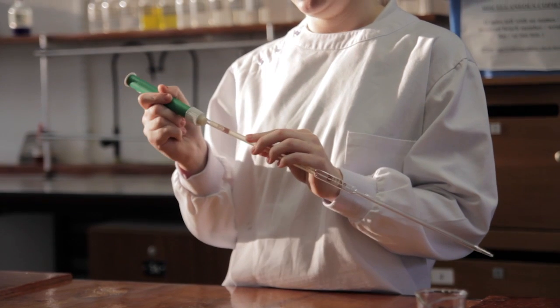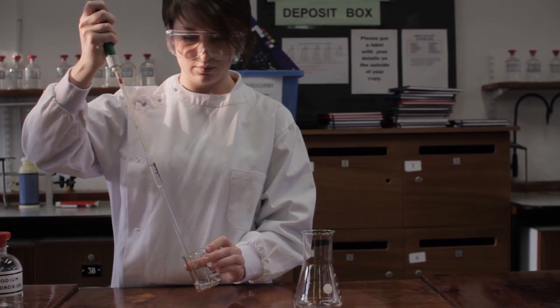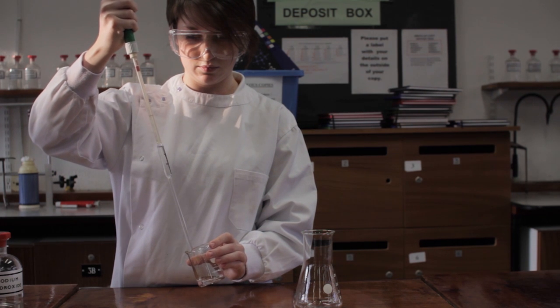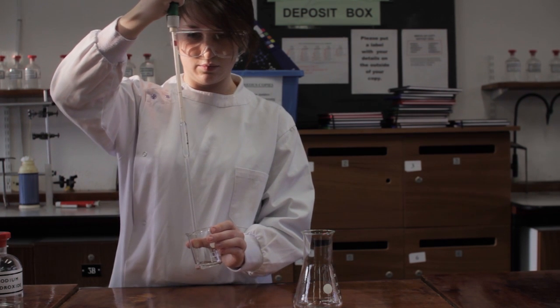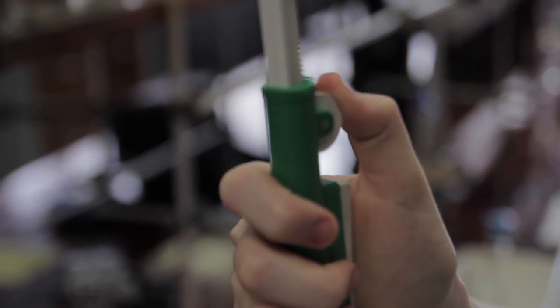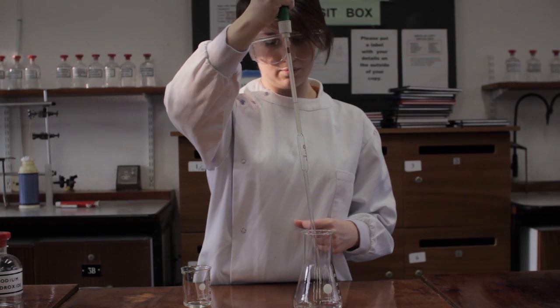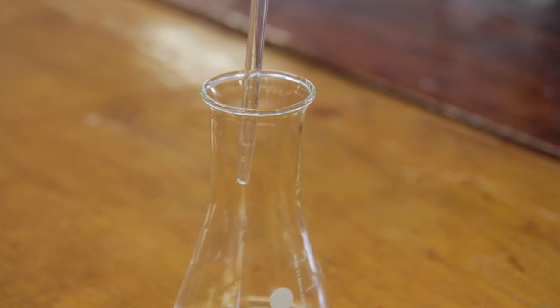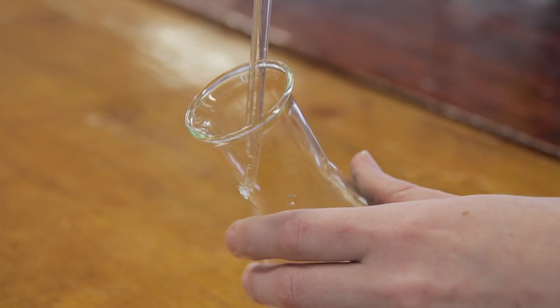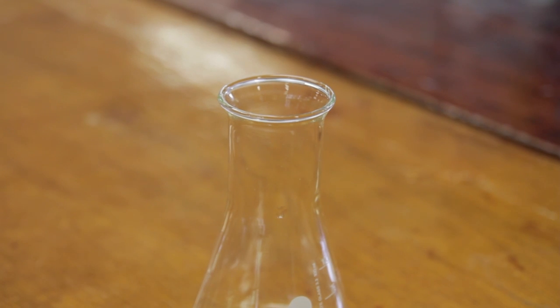As you've seen already, the pipette is used for aliquoting small accurate amounts. Before using the pipette, you must rinse it with distilled water and again with a sample of the chemical you are using. Use a pipette filler to draw the chemical into the pipette and do not exceed the calibration mark. Empty the pipette via gravity. Note: touch the tip of the pipette off the side of the conical flask to ensure it is completely empty.